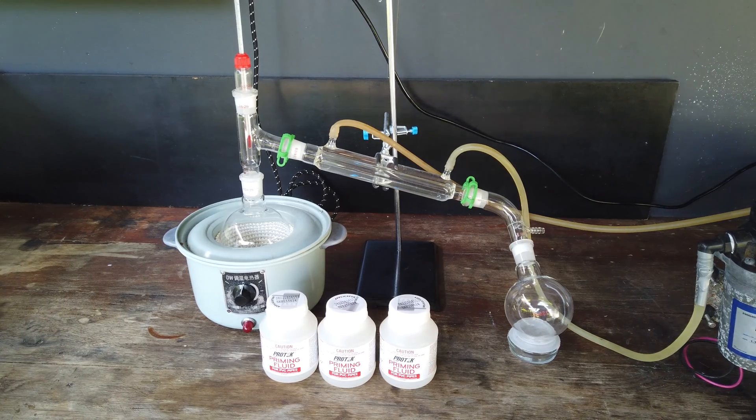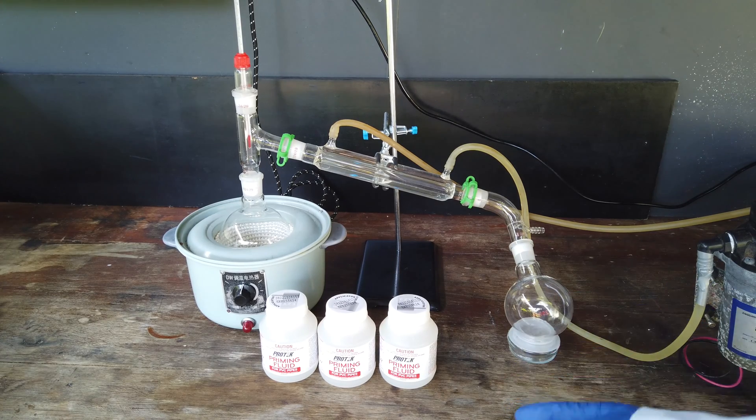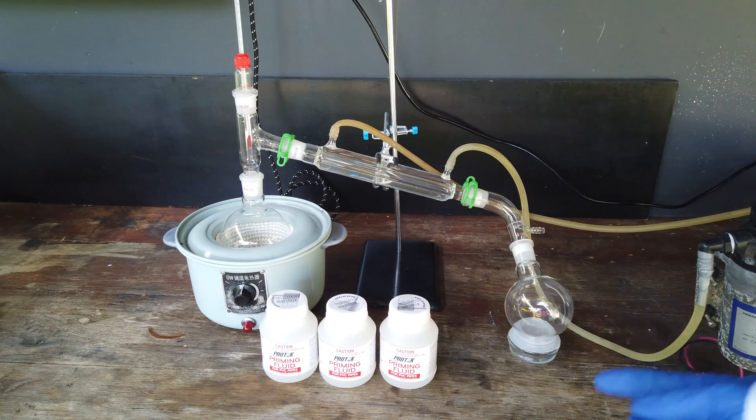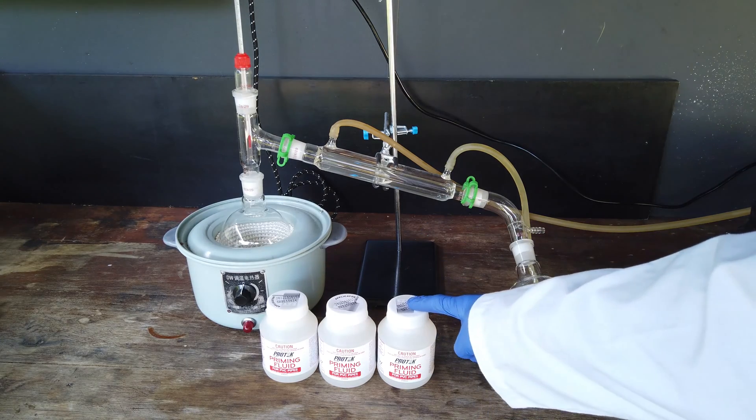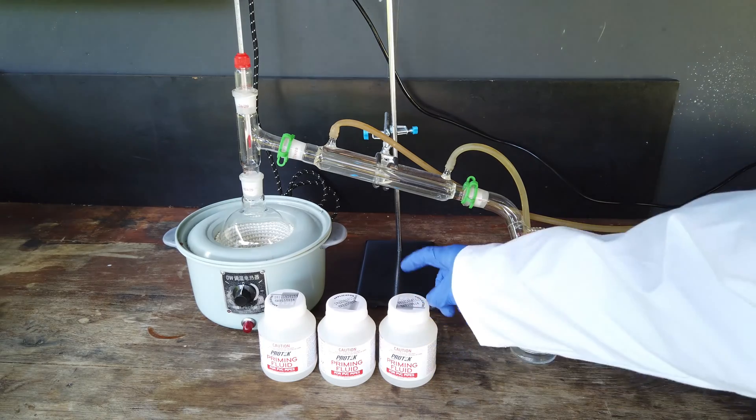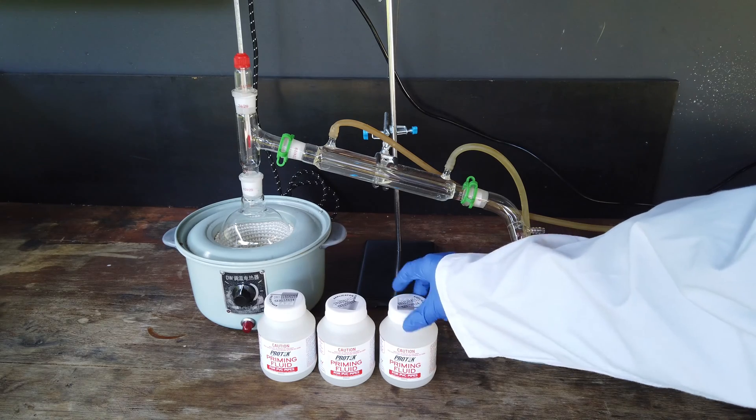For the purposes that I need methyl ethyl ketone for, I don't need it to be particularly pure. I can handle a bit of water contamination and maybe a few other hydrocarbons. But 60% is pretty bad if it's that low. I would like to do my best to purify the methyl ethyl ketone to the best of my ability.